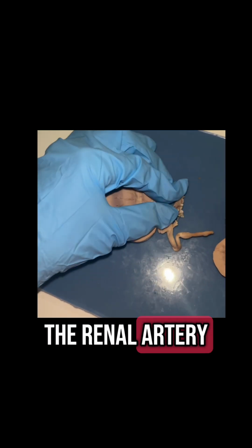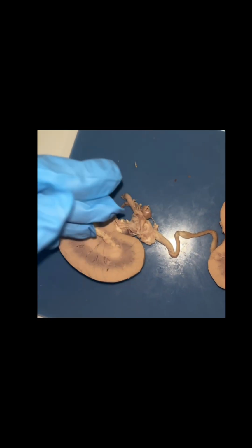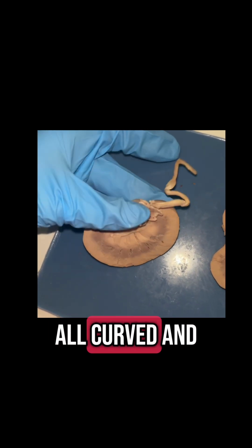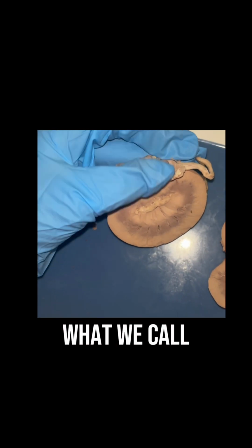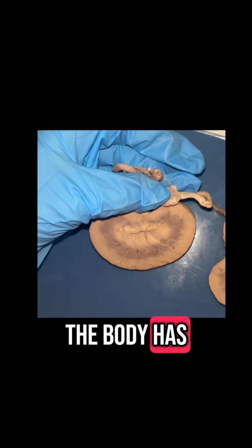Okay, next we're going to have the renal artery, and mine's going to be kind of a mess here, but it's going to be this thicker one right here. There's going to be a hole in it because mine is all curved and twisted up and inside of each other. But the renal artery is going to bring blood into the kidney straight from what we call the abdominal aorta. And this blood has wastes that the body has to filter out.